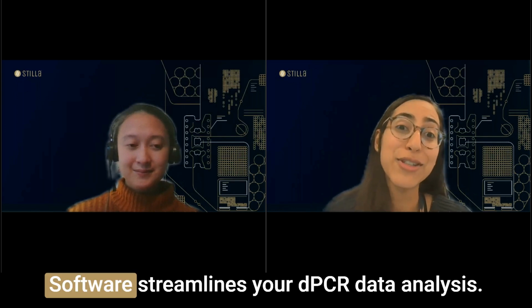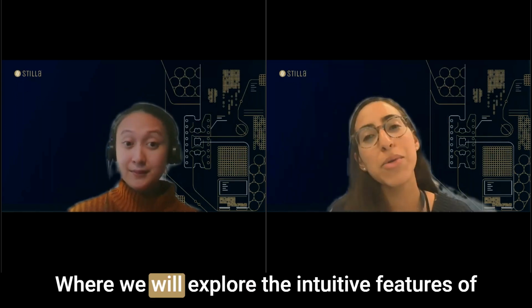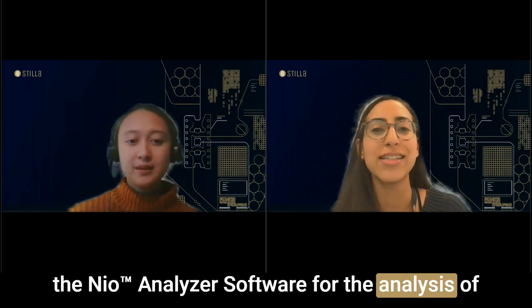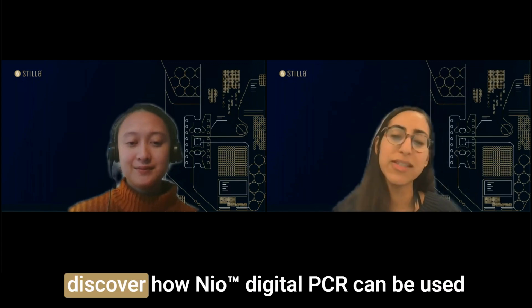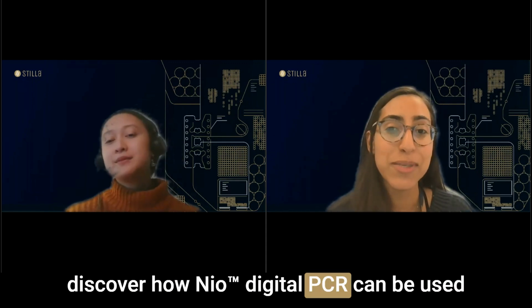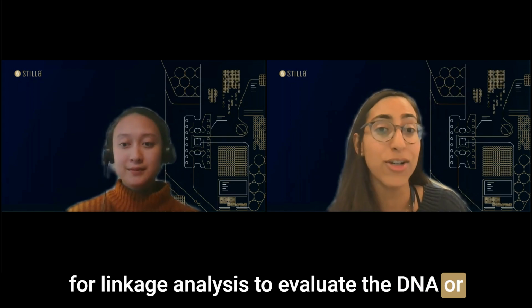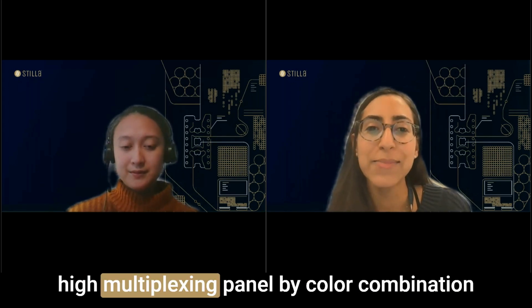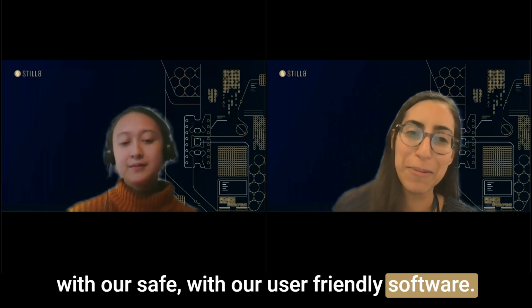Nio Analyzer Software streamlines your dPCR data analysis, where we will explore the intuitive features of the Nio Analyzer software for the analysis of dPCR data in research and GMP environments. Throughout this session, we will also discover how Nio Digital PCR can be used for linkage analysis to evaluate DNA or RNA integrity, and learn how to build your high multiplexing panel by color combination with our user-friendly software.